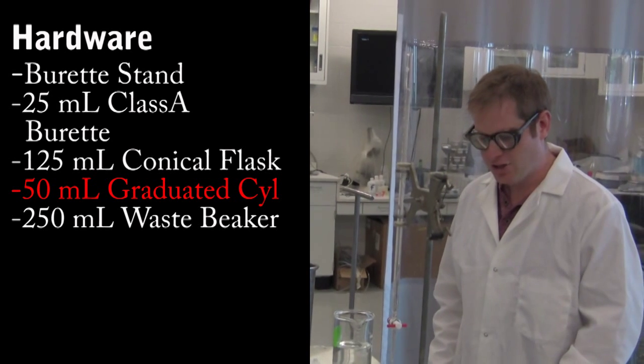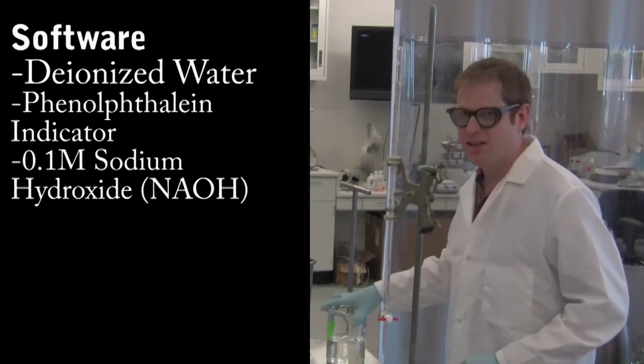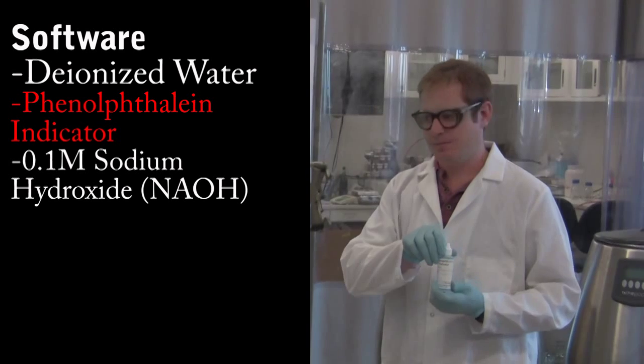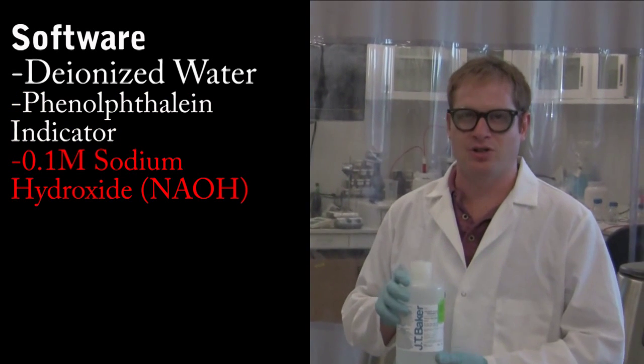For the software, we need deionized water, phenolphthalein indicator, and 0.1 normal sodium hydroxide.